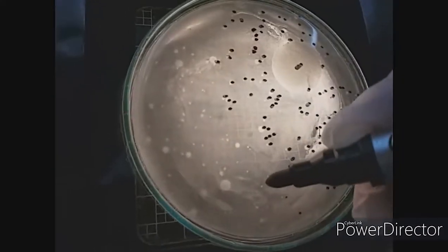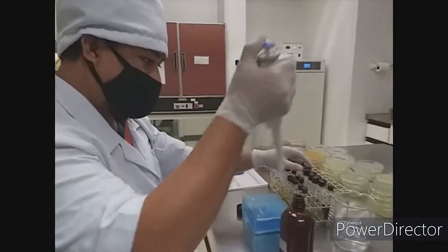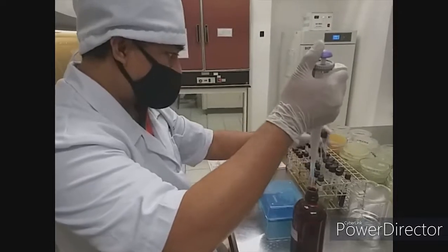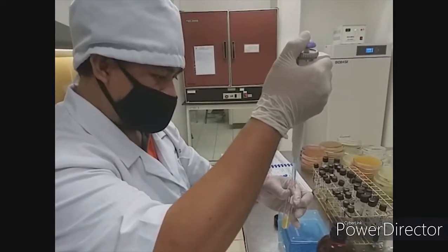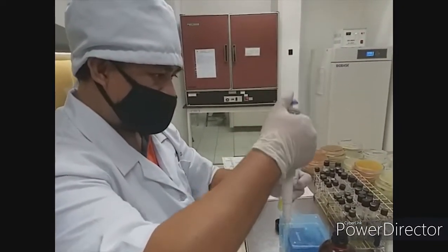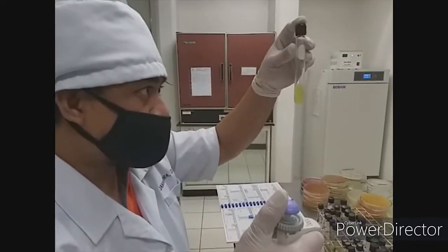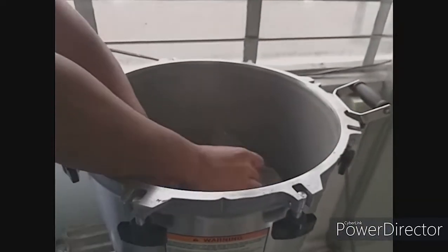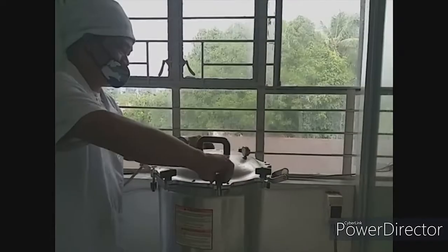After incubation, the plates and tubes are read using a colony counter. Some analyses like coliform and E. coli need a confirmatory process. Aliquots from positive tubes are put into brilliant green bile broth and E. coli broth tubes and then incubated. Tubes are then read for growth and gas production. After the analysis, used test tubes and glassware are decontaminated to kill all microorganisms present.